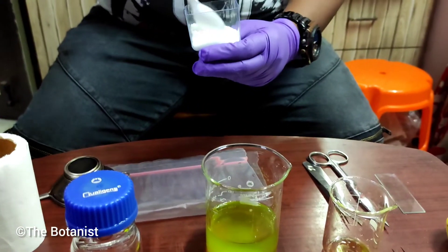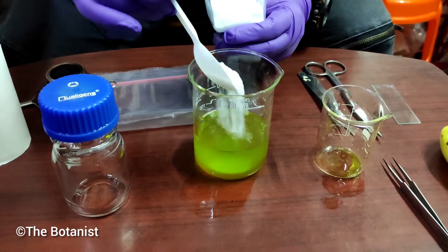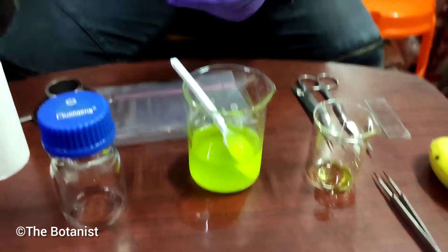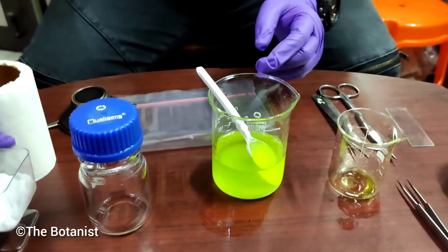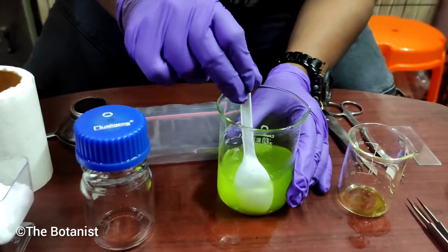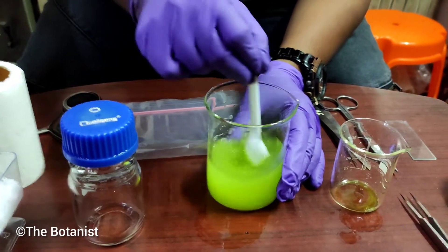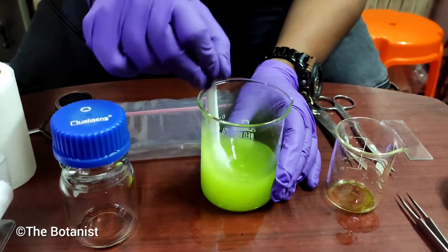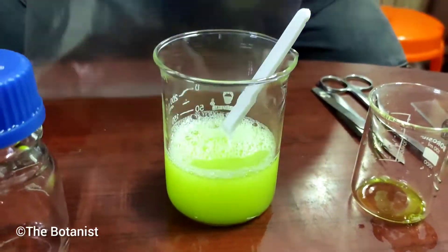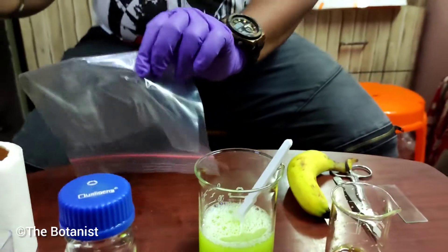The DNA's sugar-phosphate backbone is charged. By adding salt, we help neutralize the DNA charge and make the molecule less hydrophilic, meaning it becomes less soluble in water. The salt also helps to remove proteins that are bound to the DNA, and keeps those proteins dissolved in the water.